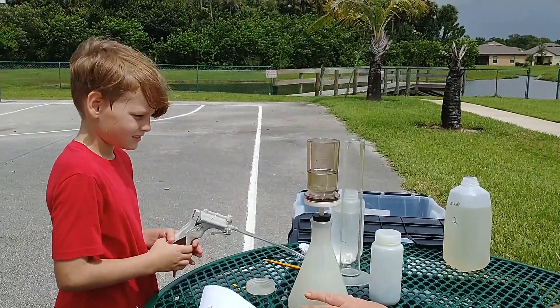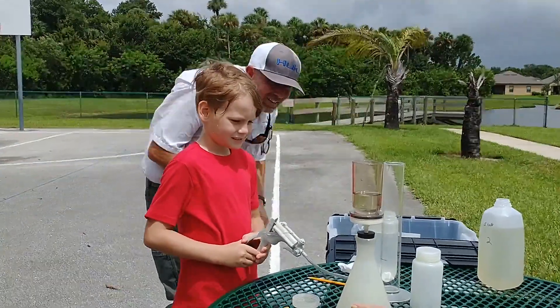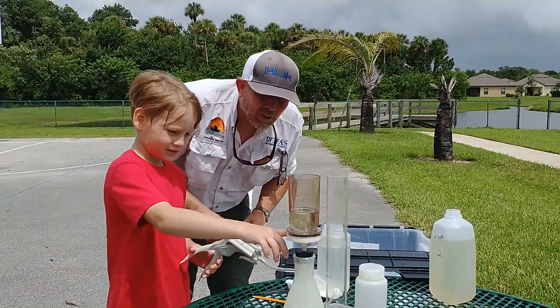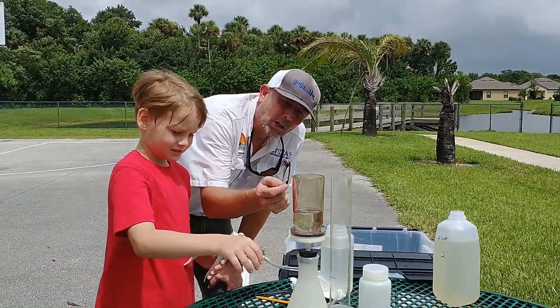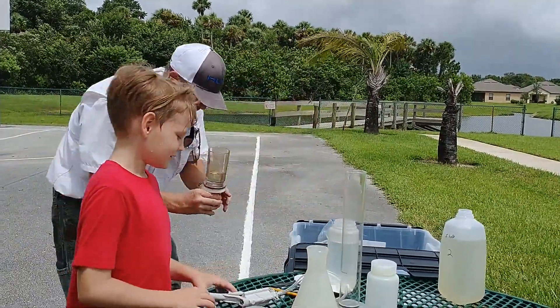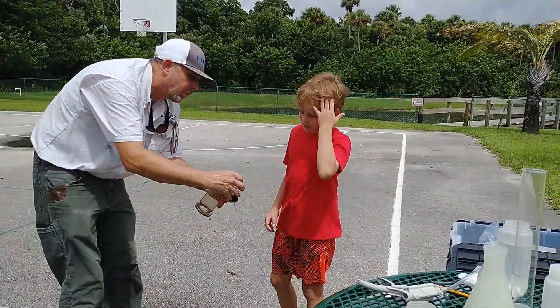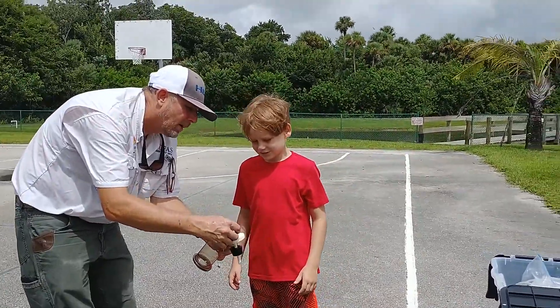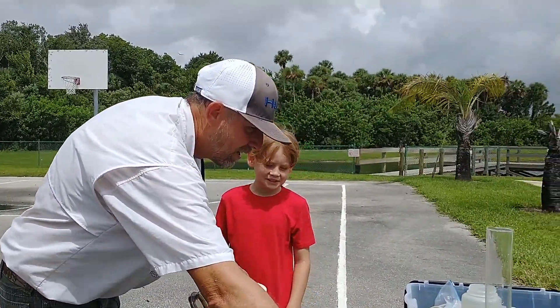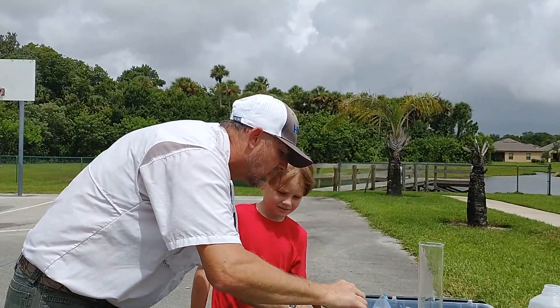Pump it until the water goes down. Use those hand muscles. You put your filter in, but there's a little bit of it that is on the side, so let's start over. See your filter? It wasn't on — it's not on. Look at the algae you've already started getting. So we'll get rid of that. Skyler, that could happen to anybody — it's actually good that you did that, because when I go to do it I could do the exact same thing.